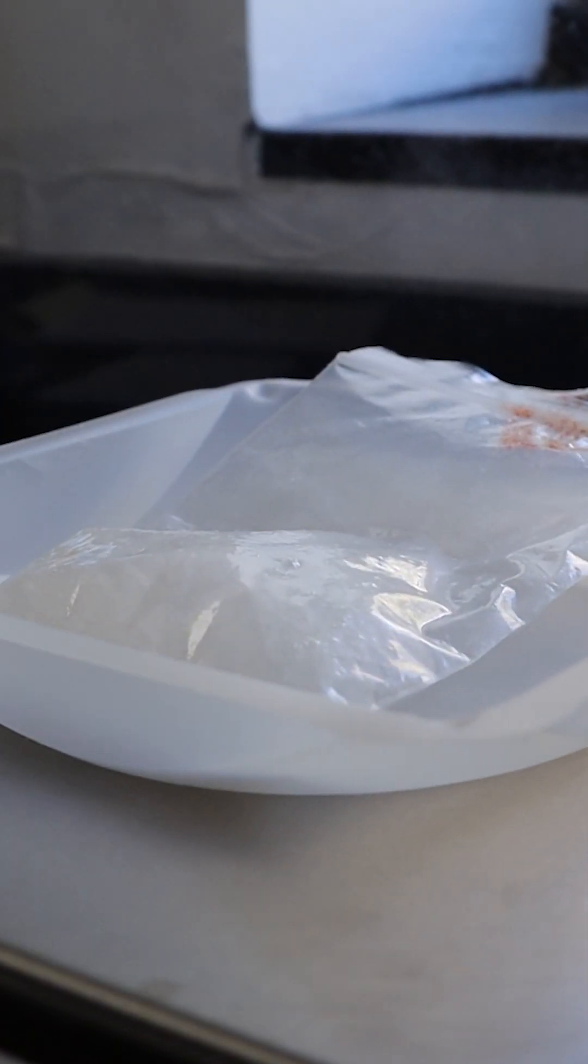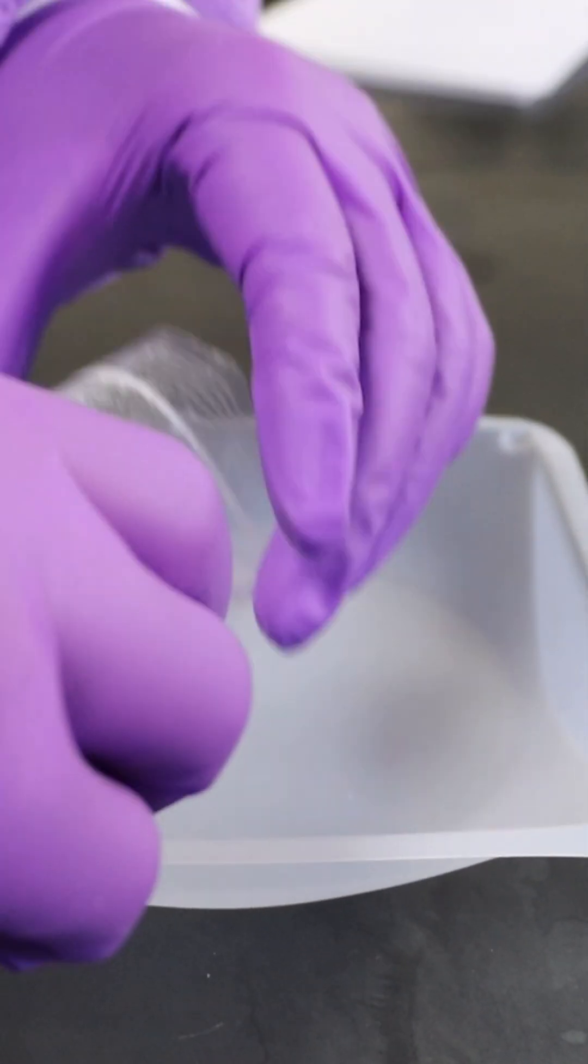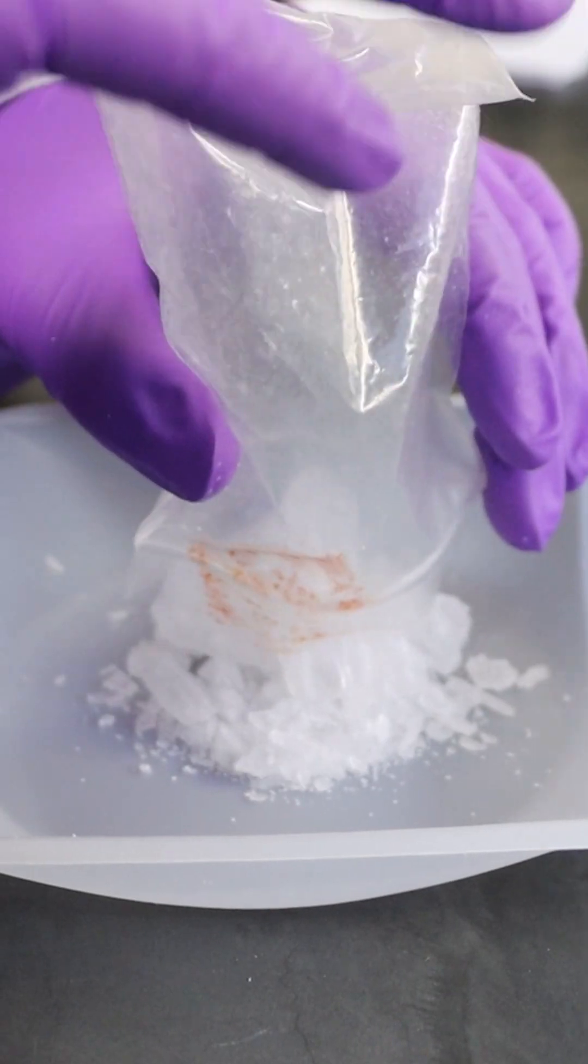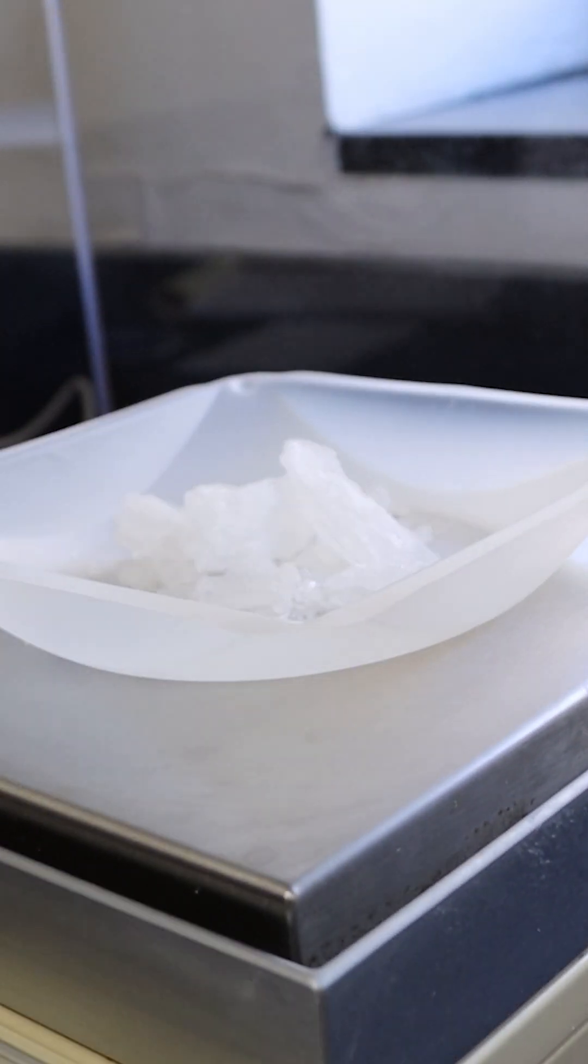I'm going to take the first weight, which is a gross weight - the plastic bag plus the contents. Then I'm going to take a net weight, which is just the crystals by themselves, and record this information.